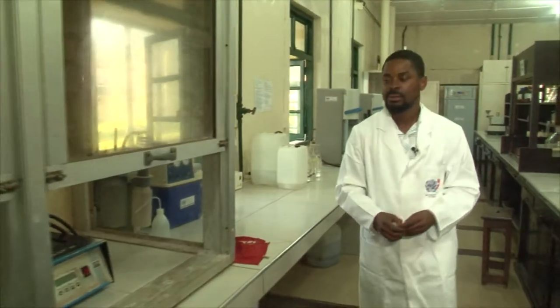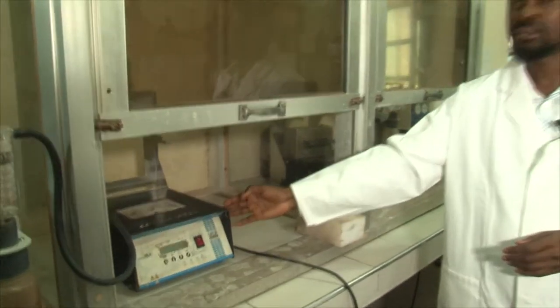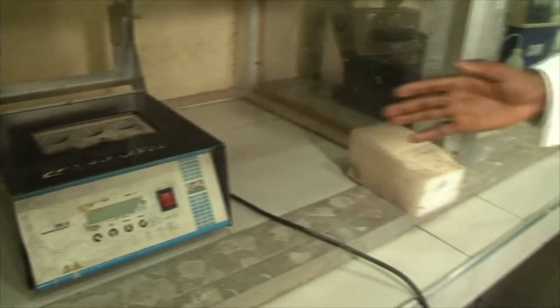It is an elaborate hub for soil analysis before the cropping season. The main objective of a farmer is to improve farm yield. The farmer has to press the right button from the start, and the scientists have identified that button to be the CSIR Soil Research Institute. The question the farmer is asking is: can this soil of mine produce the maize, the plantain, or the rice I want to produce? And that boils down to the productivity of the soil.